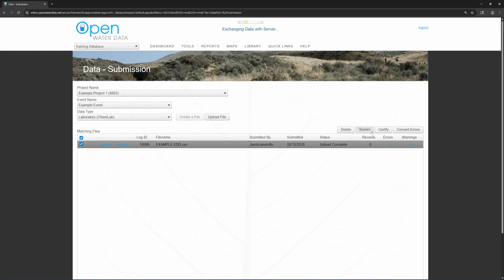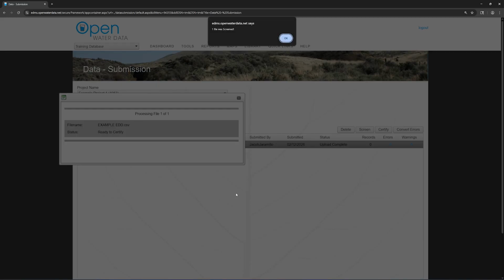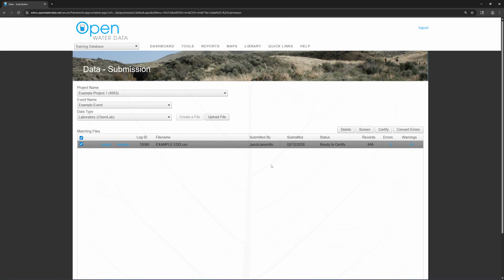When you screen the file, the system runs a series of valid value, logical, and submission checks. Checks are performed in 2 waves, so it's possible to resolve all of your errors from the first wave and then encounter more errors when the second wave of checks is run. The first wave of checks will flag valid value errors. These checks verify that valid values are being used and all fields will import into the tables successfully. The second wave of checks will flag submission errors. These checks compare the file to the EQAP and field data entered by the contractor and make sure that everything matches.